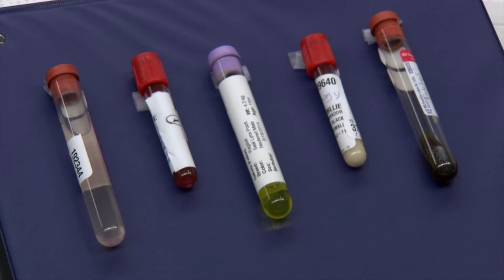And there are times when the sample is too viscous to make those slides with a PCV tube that I demonstrated. In that case you might just have to take a syringe or whatever you have that will allow you to get any material onto a slide. And then you can take your swab and swab it around to separate the cells.